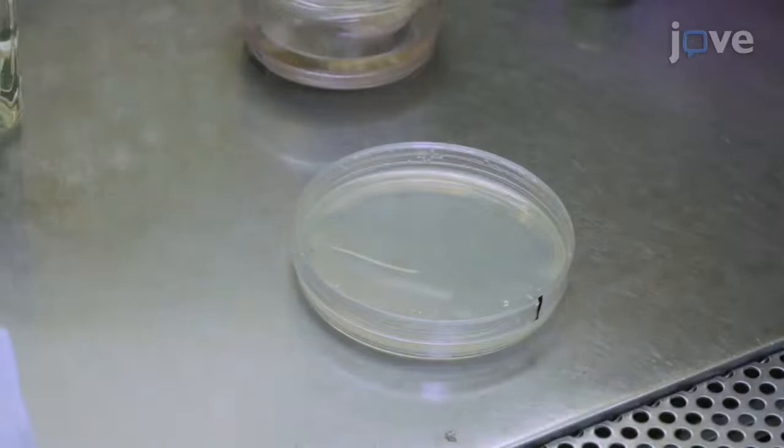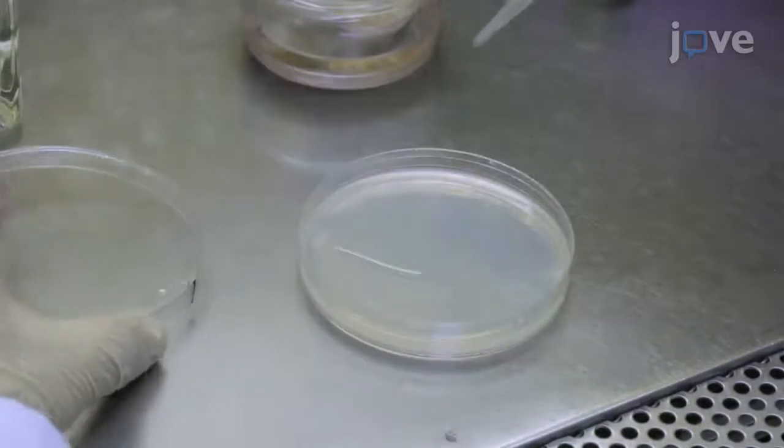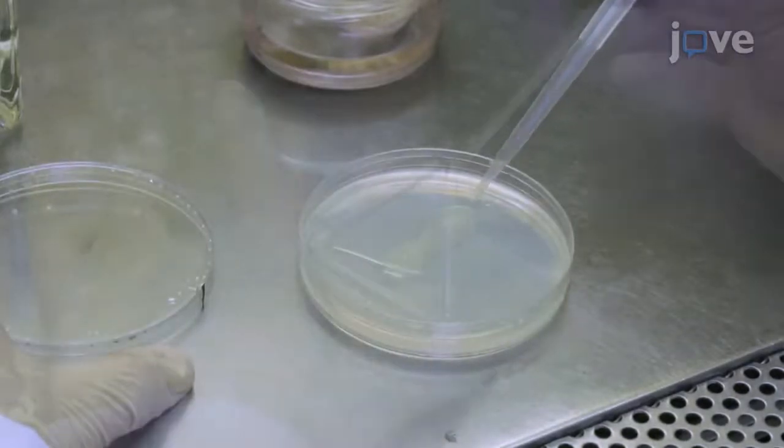Using a pipette, take 0.5 mL of E. coli OP50 LB broth and spread it on an E-NGM plate.